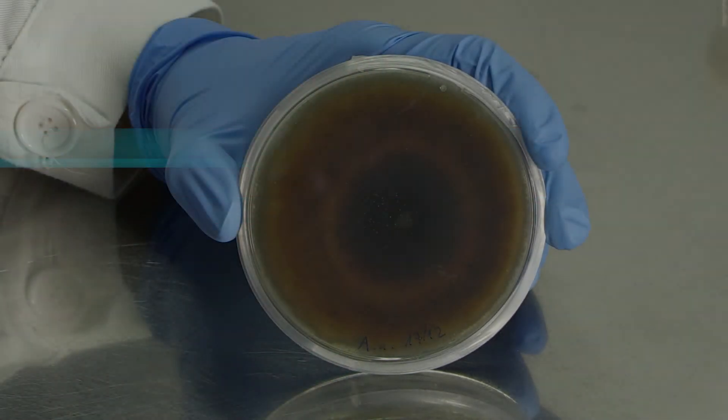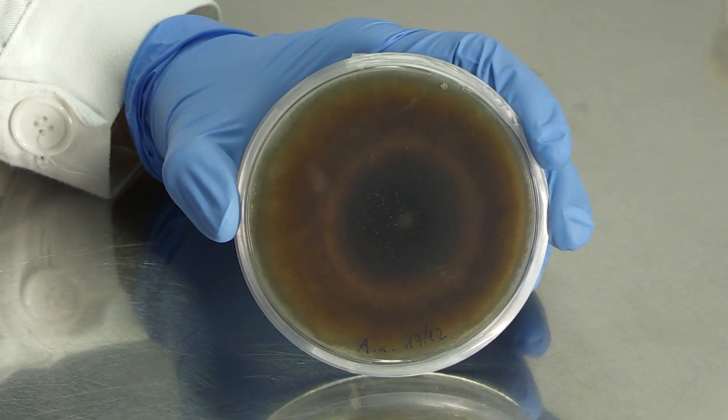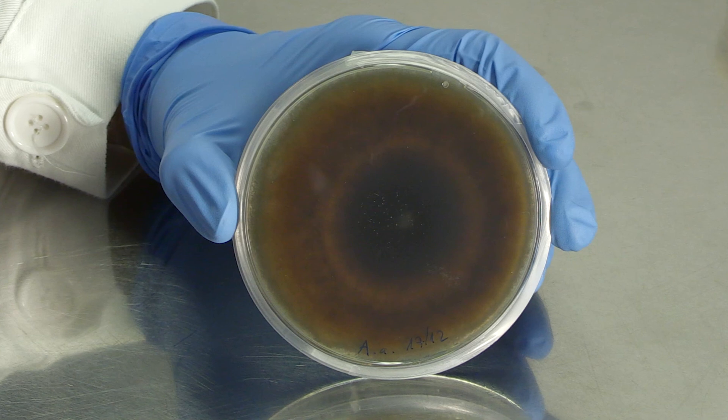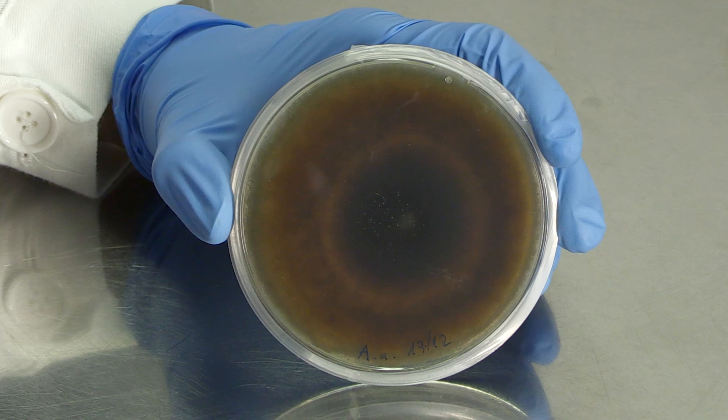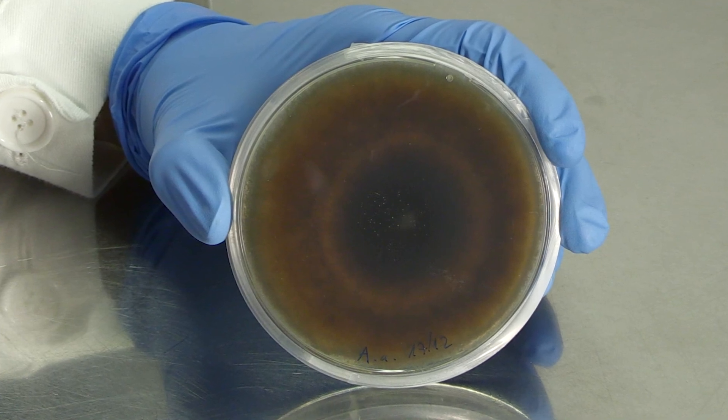Filamentous fungi are widespread organisms often associated to health risks in humans and animals. In this clip, we show how to test the antifungal activity of rosemary essential oil.